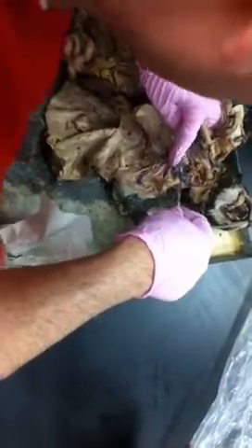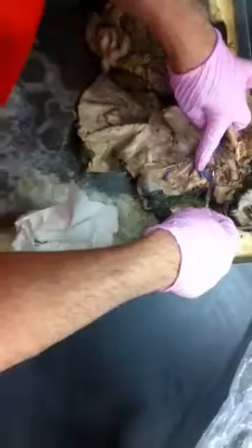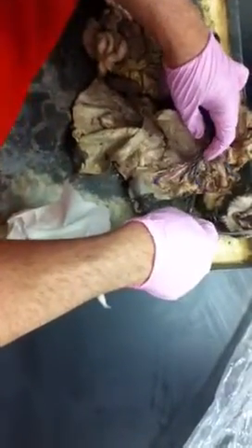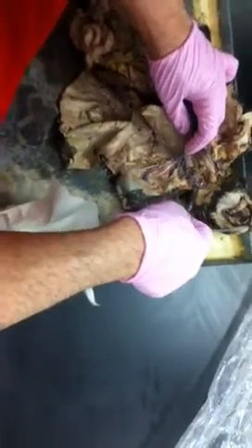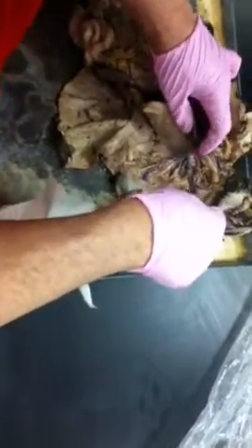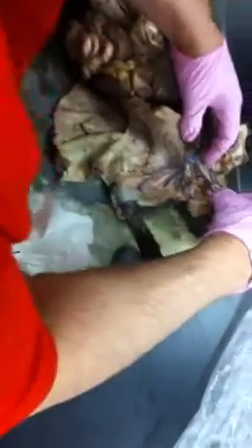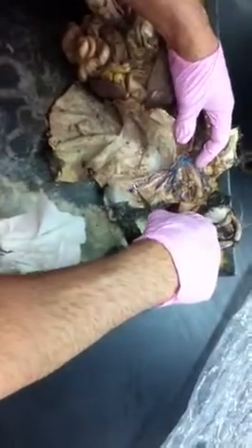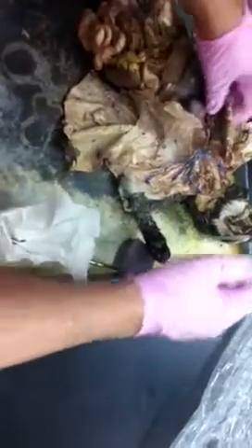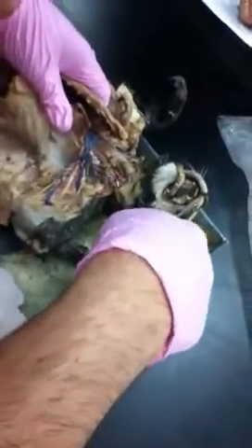I thought it was a vertebral vein, but you can actually see this going. You can actually see the external and internal on here, which is just nice. But we've got the subclavian, then we've got going into the axillary, and then we've got our brachial down here. Fair enough? External jugular would be definitely one to know. As I said, common carotid's one to know.